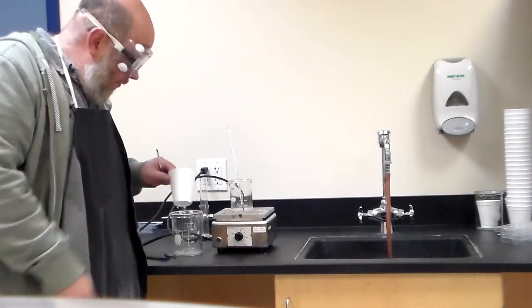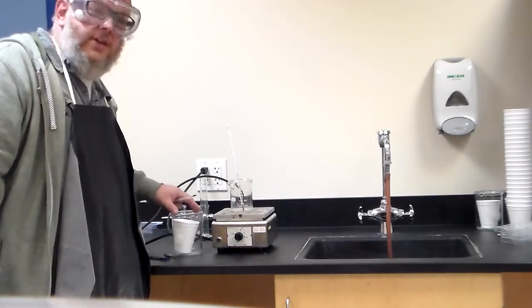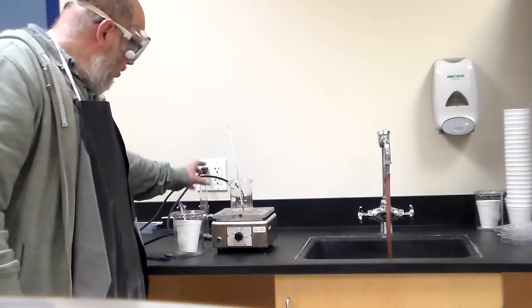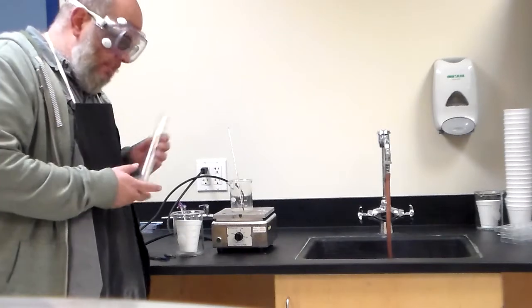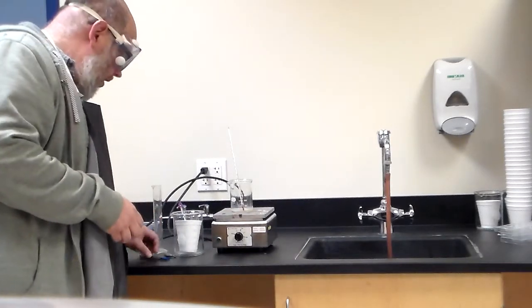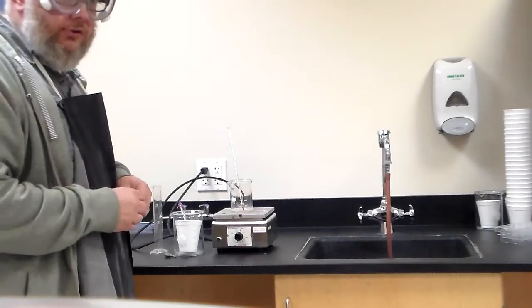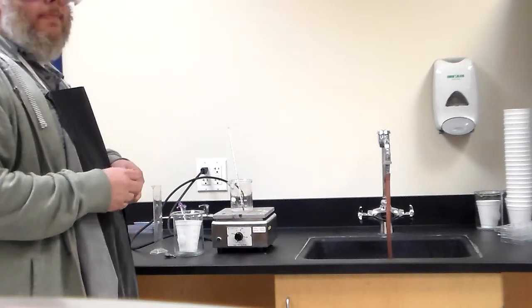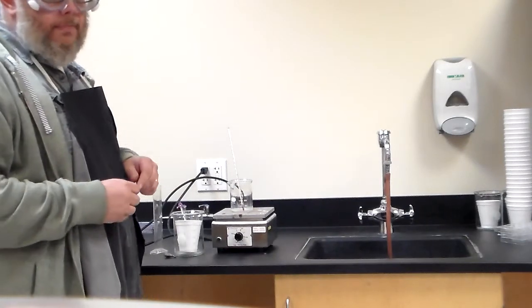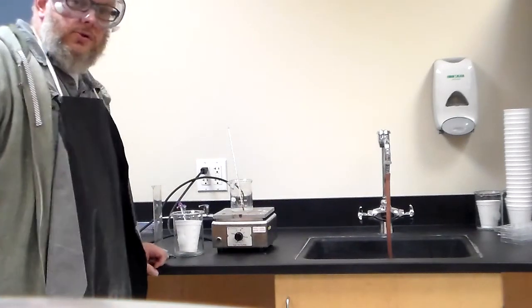Now, I put the styrofoam cup in the bigger beaker to provide stability, so that it's less likely to tip over for the water. You also have your graduated cylinder that we're going to be using to make precise measurements of the amount of water that you're going to need, the chunk of metal that will be assigned to you, and then something to get the metal out of here when it's nice and hot and put it in here. All right, that concludes the video.